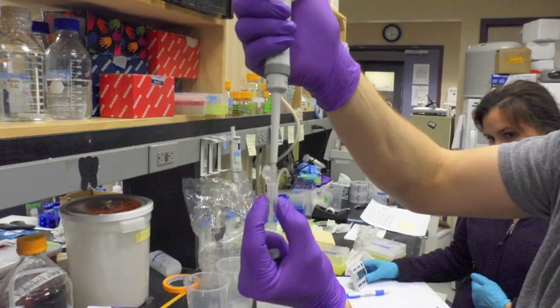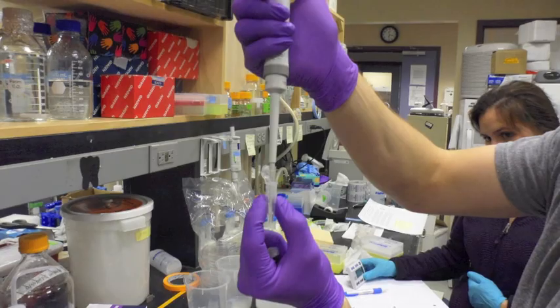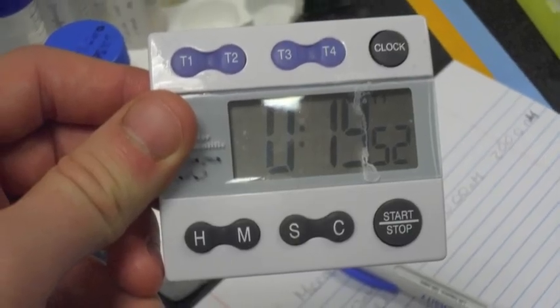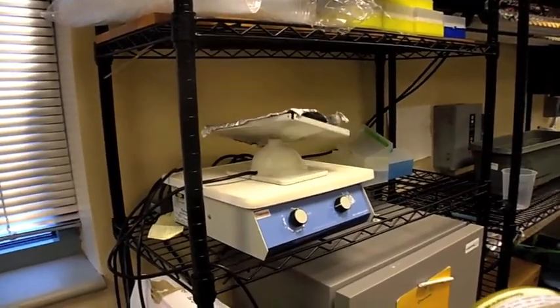Next, add the four fluorescence-labeled target DNA solutions into each microparticle tube. Remembering to keep the samples covered, incubate the samples on a rotator for 20 minutes at room temperature.